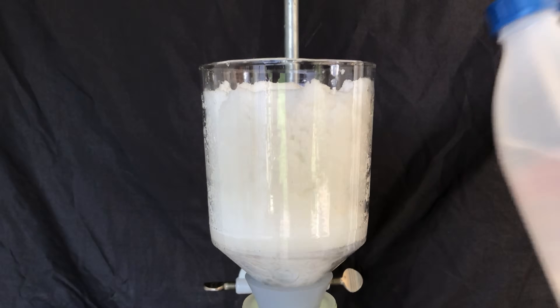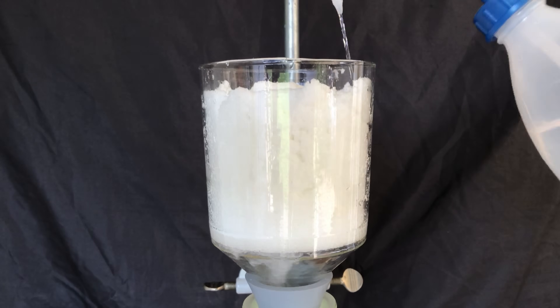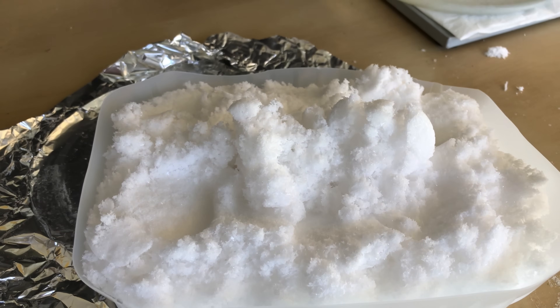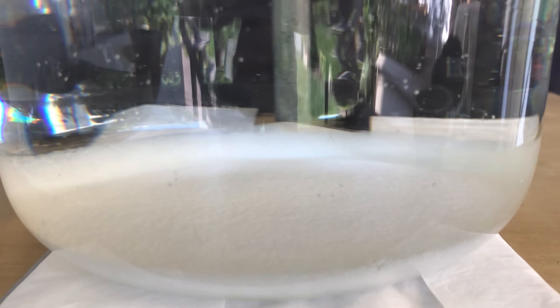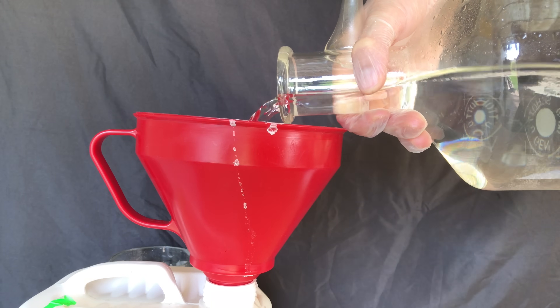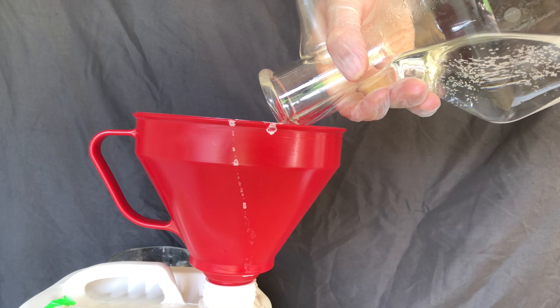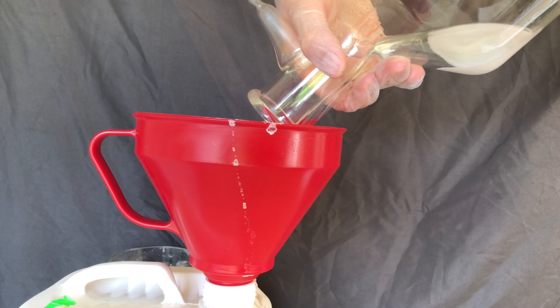To get rid of leftover potassium bromide, the filter cake was washed one time using distilled water. The still wet bromate was scraped into a plastic tray which was then put into my vacuum desiccator over anhydrous calcium chloride. More potassium bromate crashed out after the filtration but it's not a lot, and I prioritized purity over yield. All contaminated solutions were collected — they still contain a lot of potassium bromide and potassium bromate, and we are going to recover bromate from it.